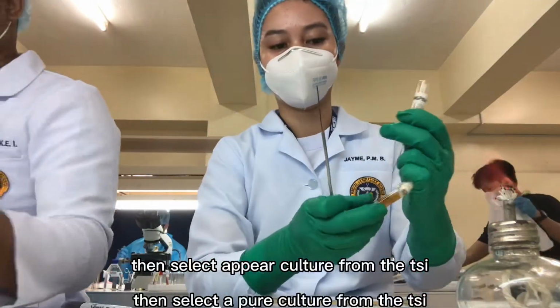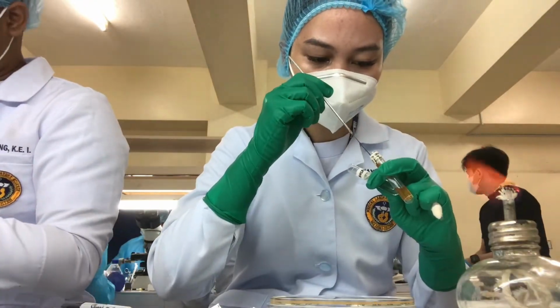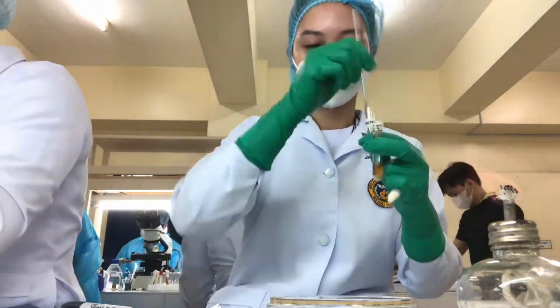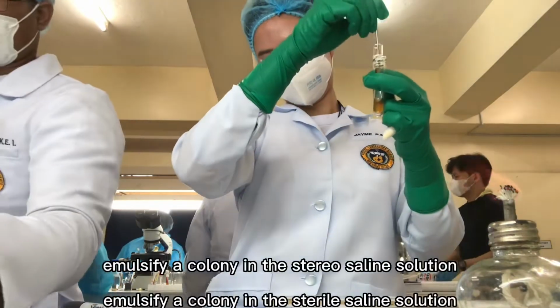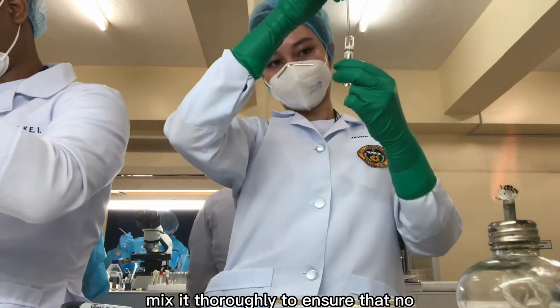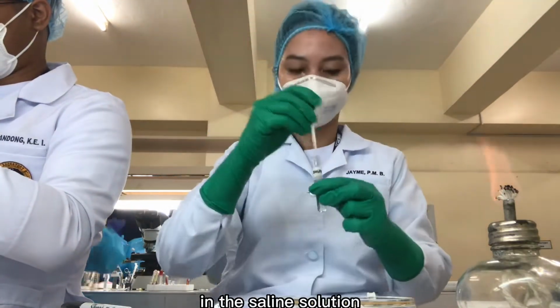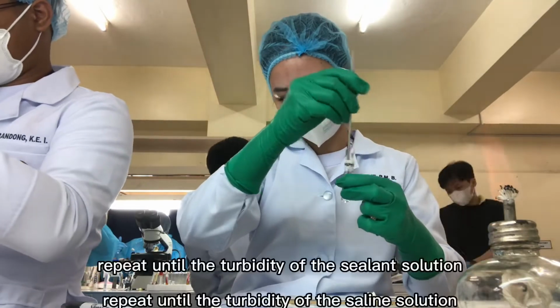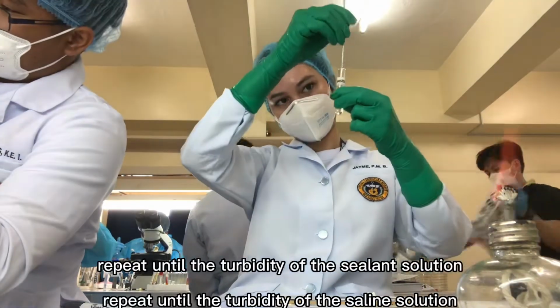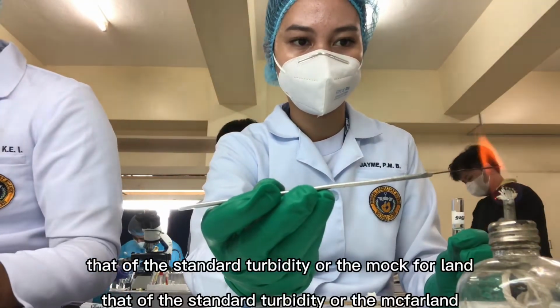Then, select a pure culture from the TSI. Aseptically emulsify a colony in the sterile saline solution. Mix it thoroughly to ensure that no solid material from the colony is visible in the saline solution. Repeat until the turbidity of the saline solution visually matches that of the standard turbidity, or the McFarland.